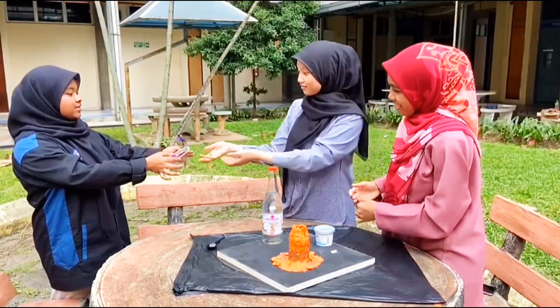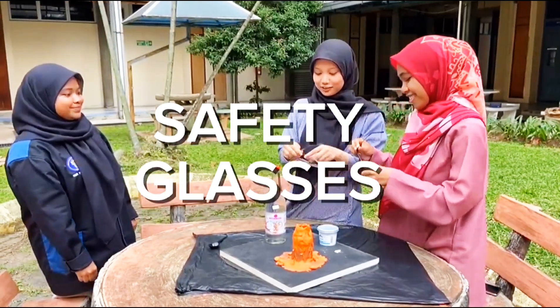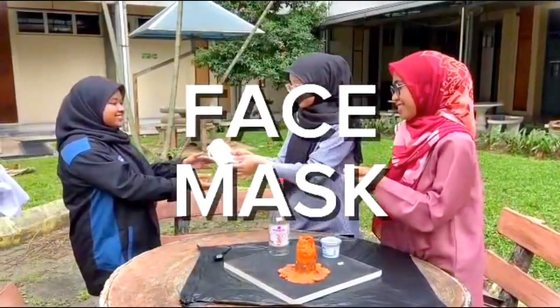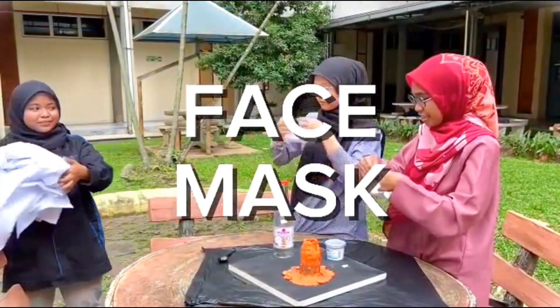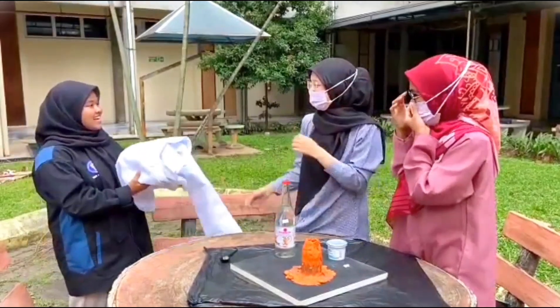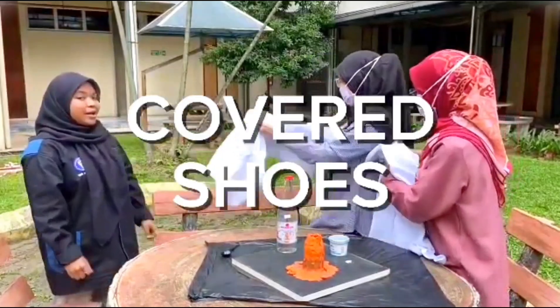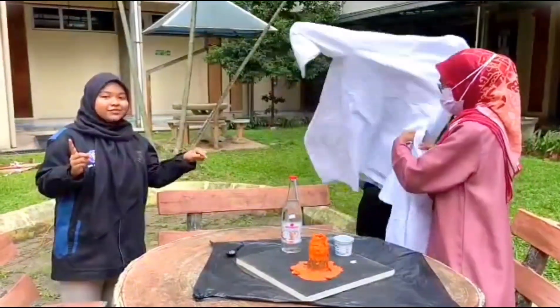You wear the glasses to replace the goggles. Next, don't forget to wear the mask. Next is a lab coat. Make sure before you start the experiment, you wear covered shoes.